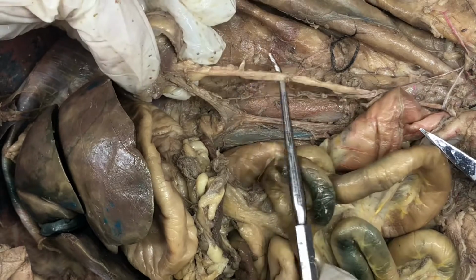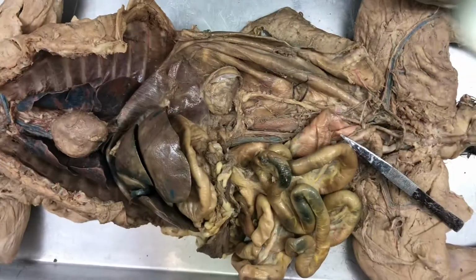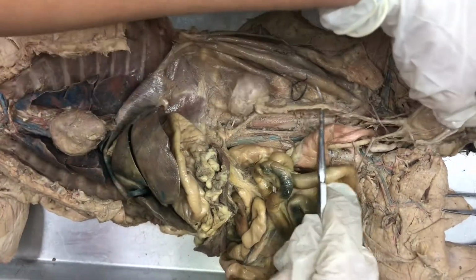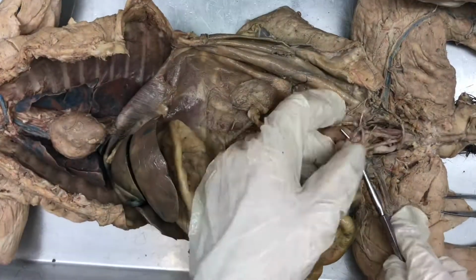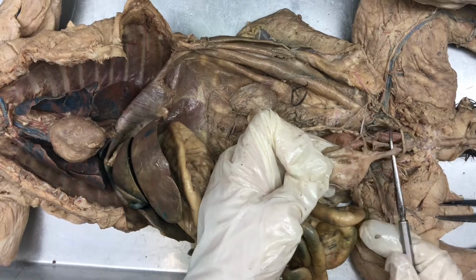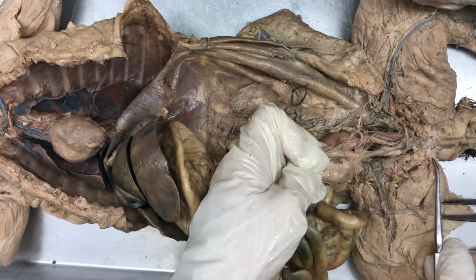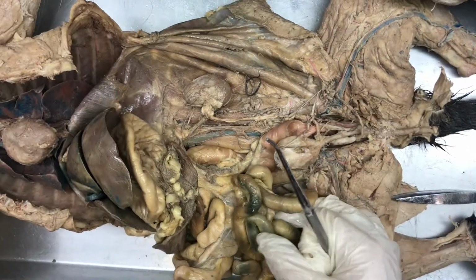And so this is the ureter right here. And the ureter will run all the way down into the urinary bladder. So you can see the ureter connects to the urinary bladder right there. And then from the urinary bladder, we have the urethra, which will take the urine out of the cat, whether it's through the urogenital sinus or through the penis, if it's a male. And that is all the structures for this video.